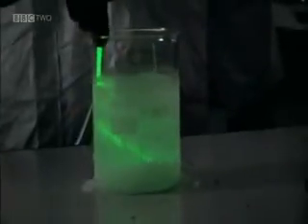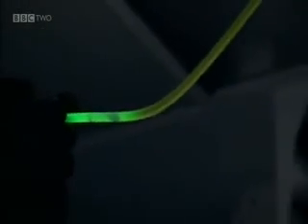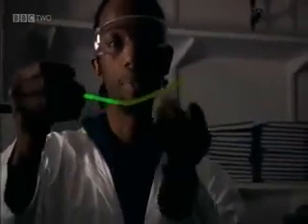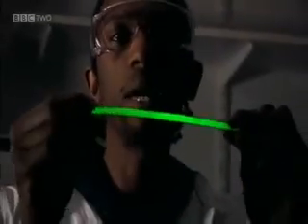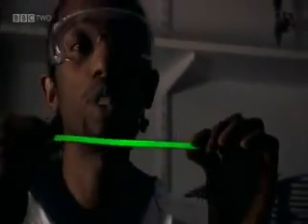Now let's see what would happen if we cool it down. As you can see, the reaction gives off light. This one isn't giving off light, so the reaction appears to have slowed down. If we cool it down and the reaction slows down, what happens if we heat it up? Well, let's give it a go — a bit of friction to heat it up. As we warm up the solution, the reaction starts to give off light again, even more light than before. And because it's now got warmer, the reaction has sped up. So we can say that increasing temperature speeds up the reaction, and decreasing the temperature slows down the reaction.